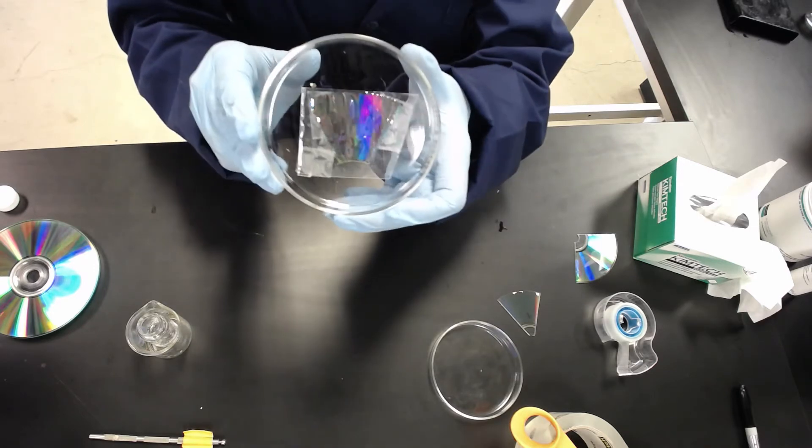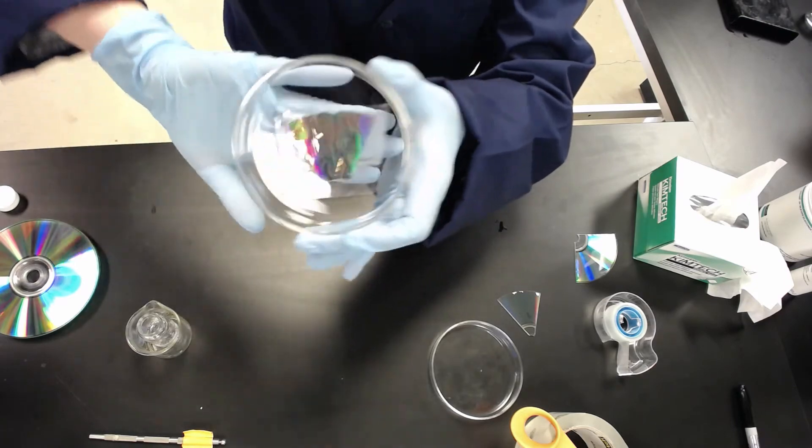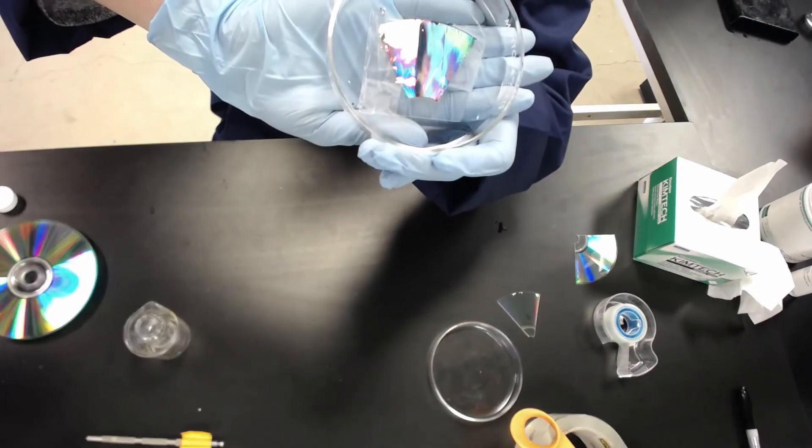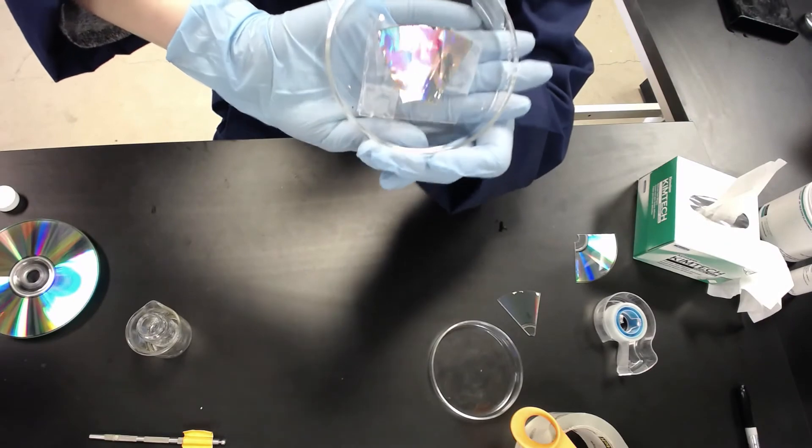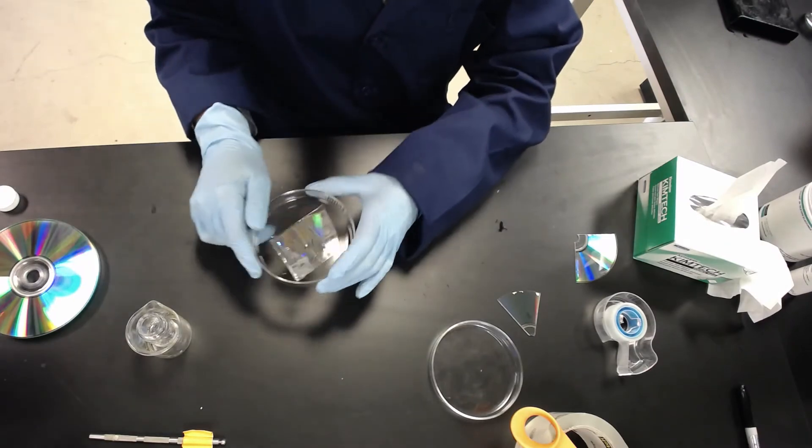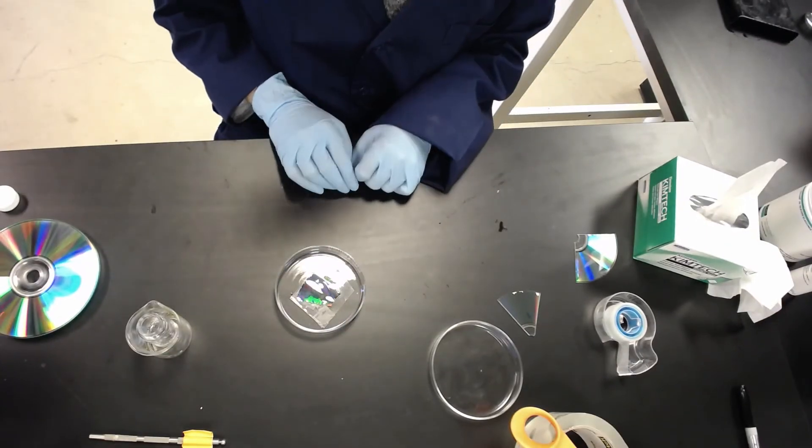Great. So now we have our aluminum taped down in our petri dish—so shiny—ready for our next steps.